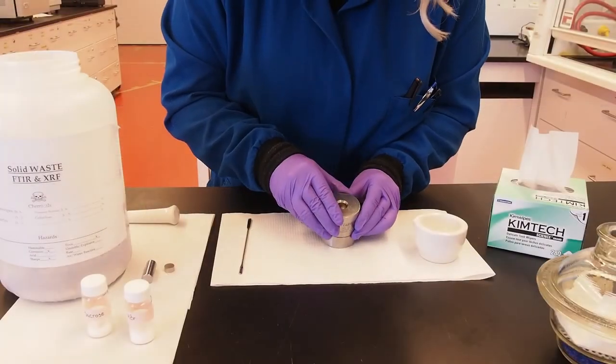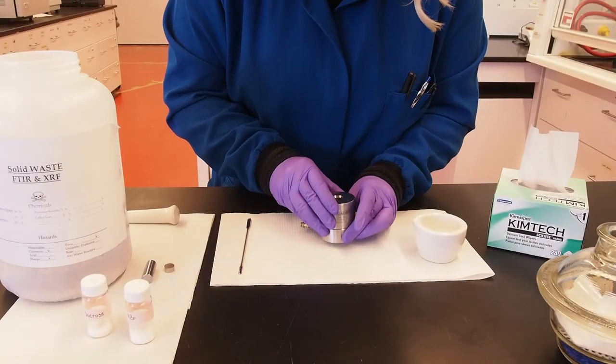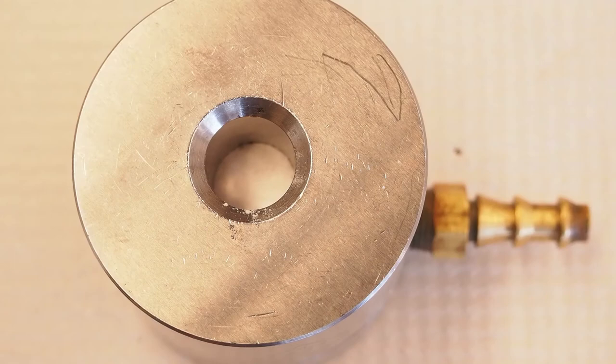It may be necessary to lightly tap the die to evenly distribute the solid. The spacer should be fully covered by a solid layer.